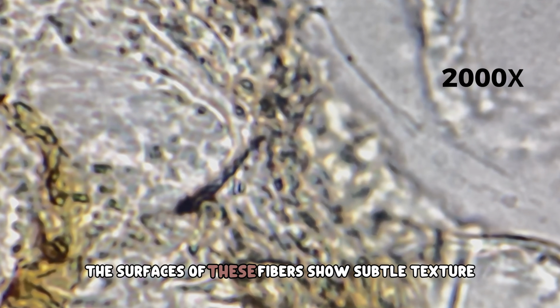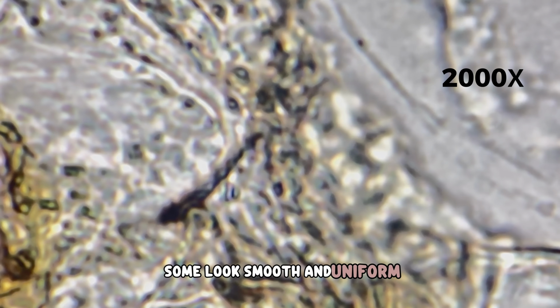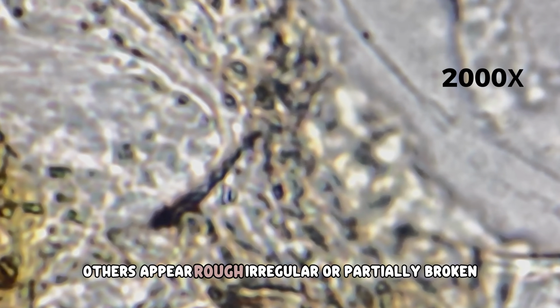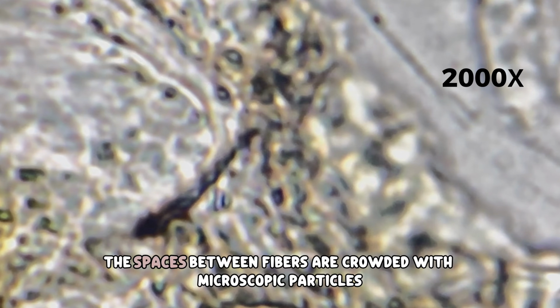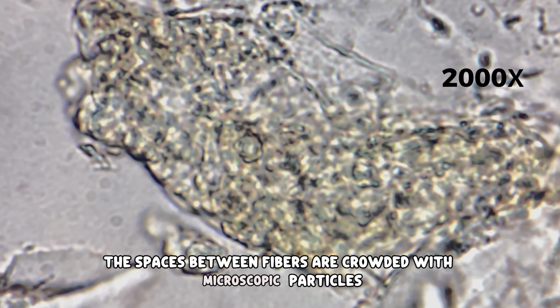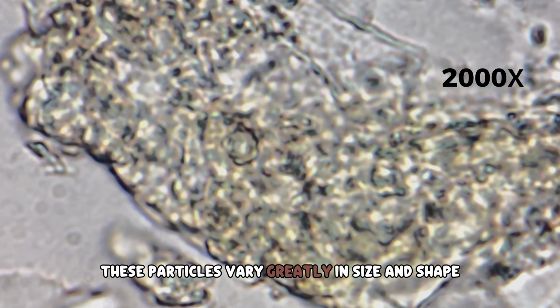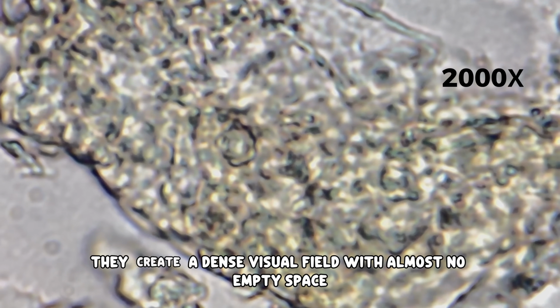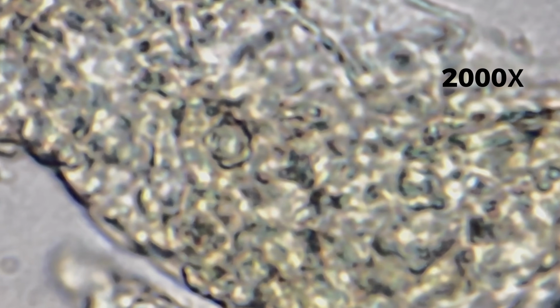The surfaces of these fibers show subtle texture. Some look smooth and uniform. Others appear rough, irregular, or partially broken. The spaces between fibers are crowded with microscopic particles. These particles vary greatly in size and shape. They create a dense visual field with almost no empty space.